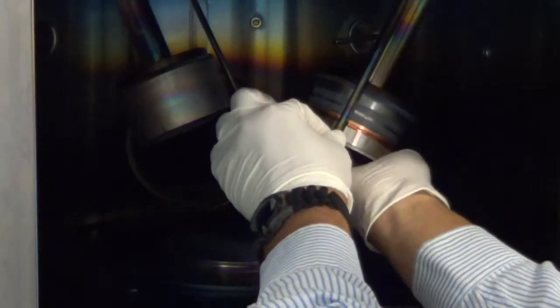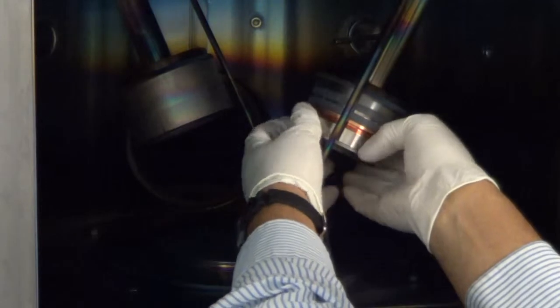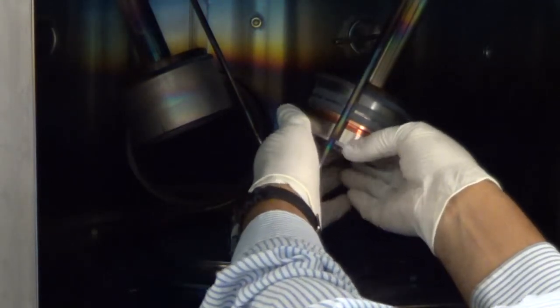Next, you remove this target clamp. This also unscrews. So you don't require any tools in the case of this particular cathode.